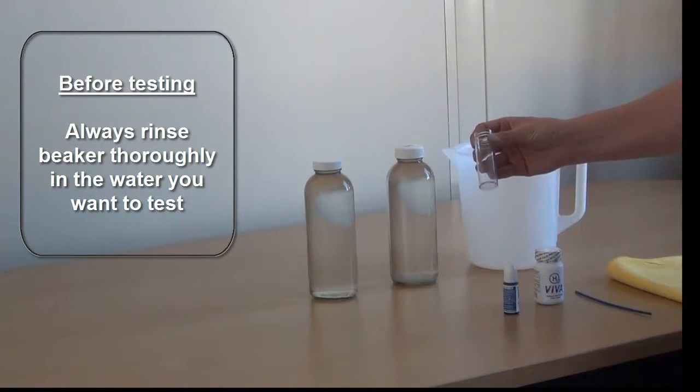Always rinse the beaker thoroughly before testing in the water that you're going to test.